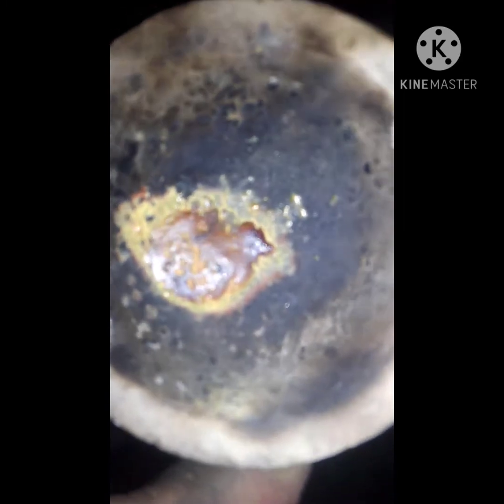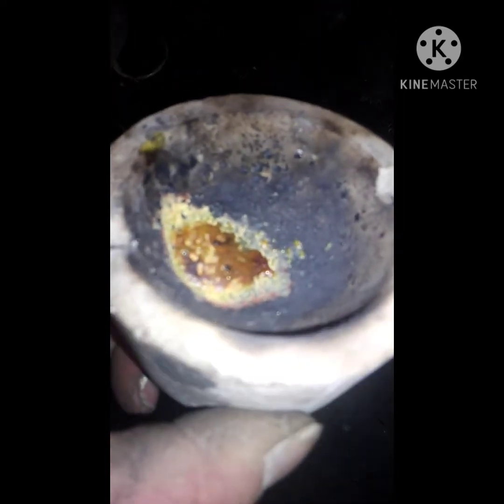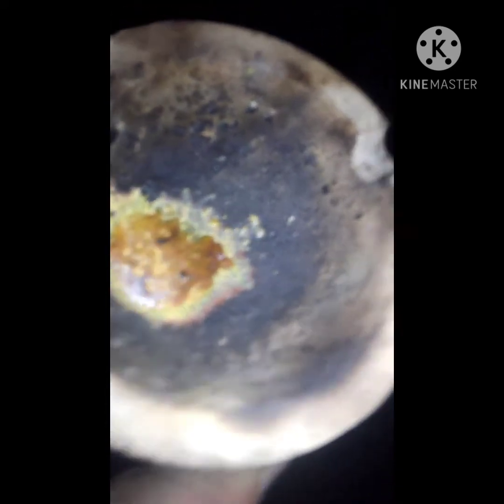Here I'll do a little bit more — that wasn't really a good example, I suppose. Right now it's kind of turned to a liquid, at least the top has. Now that it's cooled, it's like a dirty yellow color. And then under it, it's still that original color.